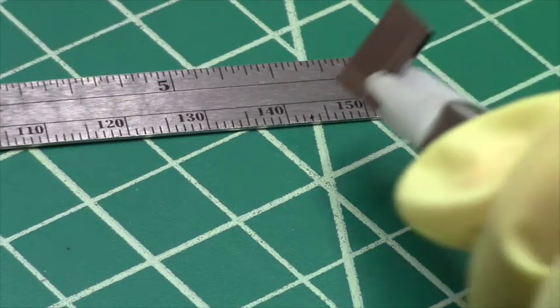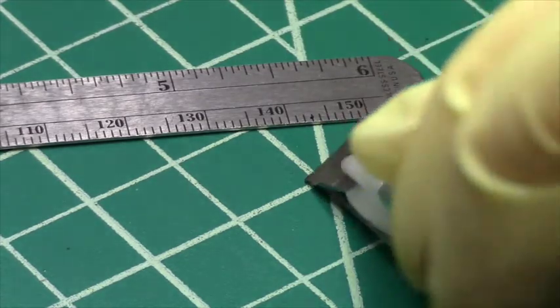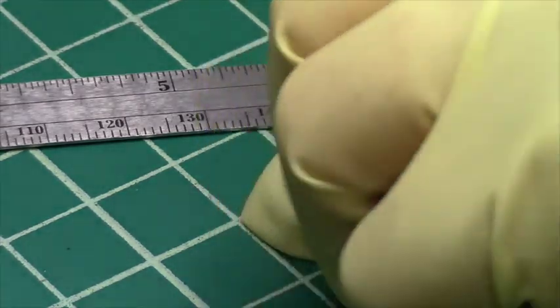I scribe the sample manually and I'm cleaving with the small sample pliers. Now I'll separate the narrow strip from the larger sample.